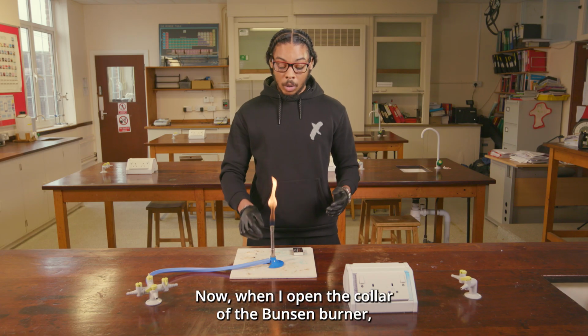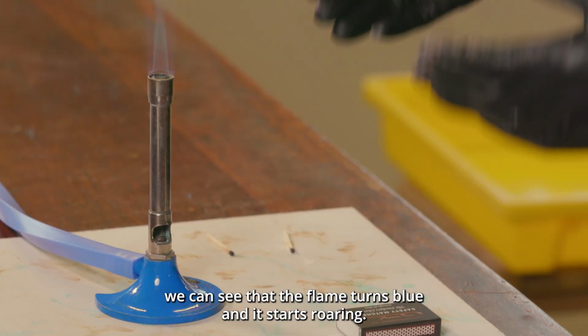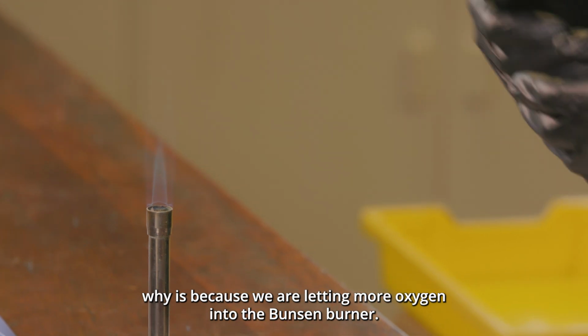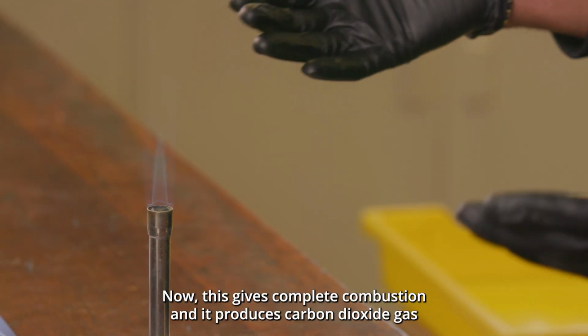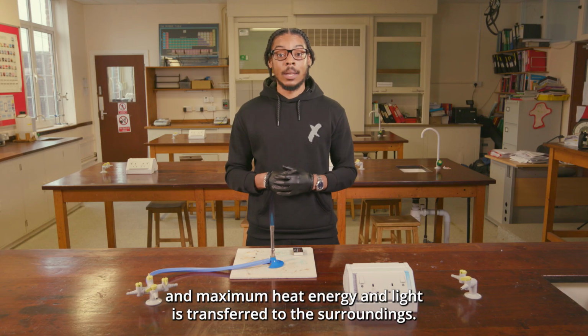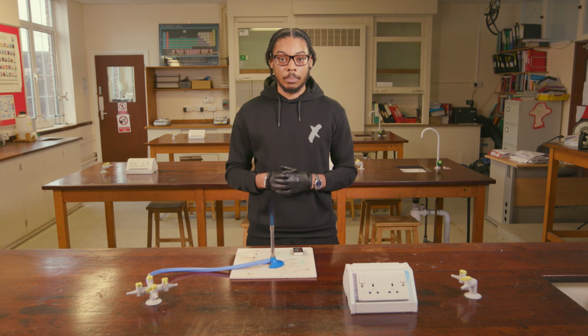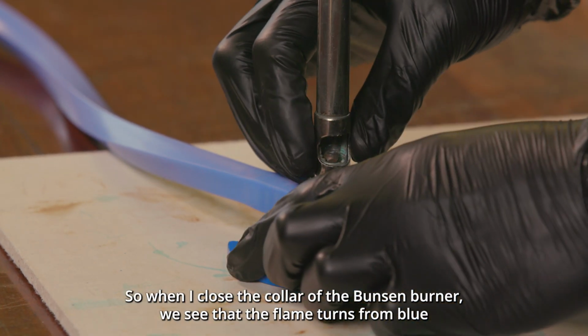Okay, now when I open the collar of the Bunsen burner, we can see that the flame turns blue and it starts roaring. The reason why is because we're letting more oxygen into the Bunsen burner. This gives complete combustion and it produces carbon dioxide gas, and maximum heat energy and light is transferred to the surroundings.